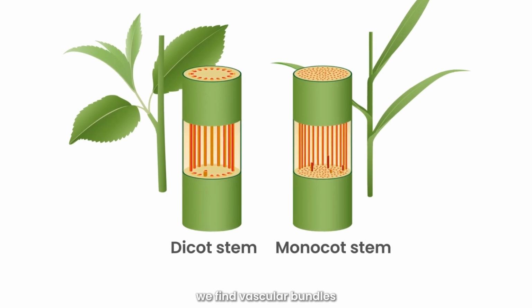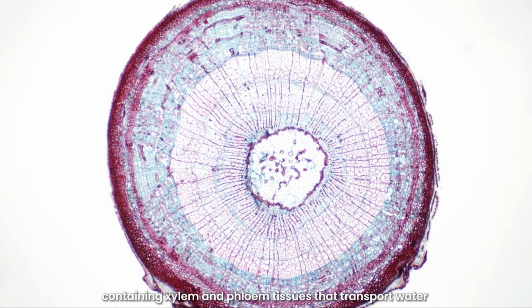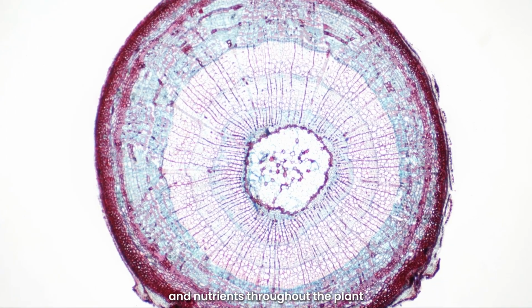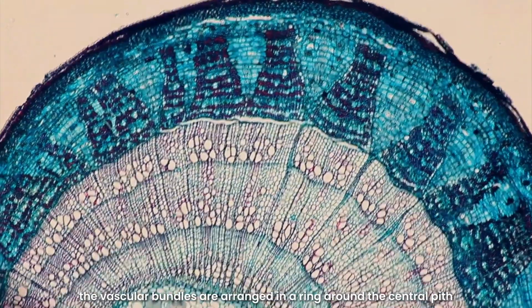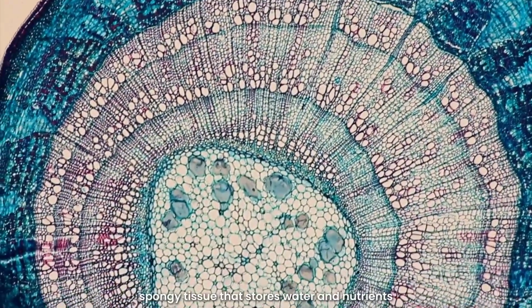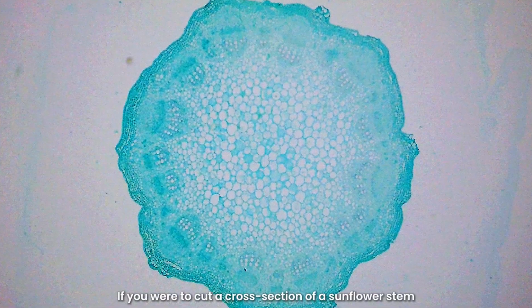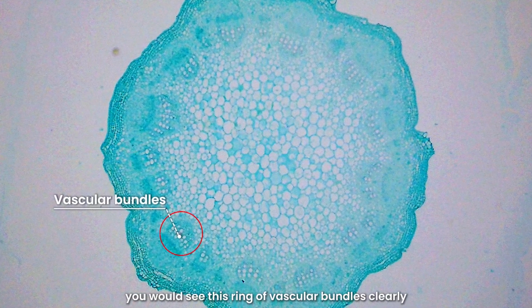Inside the stem, we find vascular bundles, which are like the plant's plumbing system, containing xylem and phloem tissues that transport water and nutrients throughout the plant. In dicots, the vascular bundles are arranged in a ring around the central pith, which is a soft, spongy tissue that stores water and nutrients. If you were to cut a cross-section of a sunflower stem, you would see this ring of vascular bundles clearly.